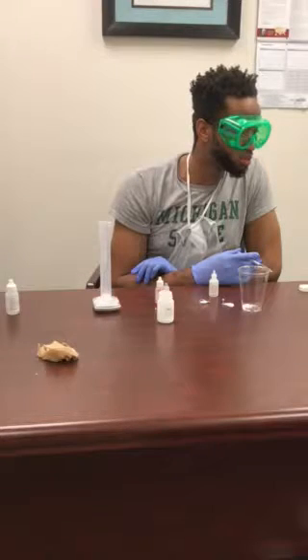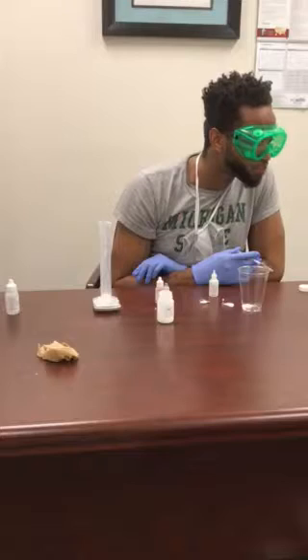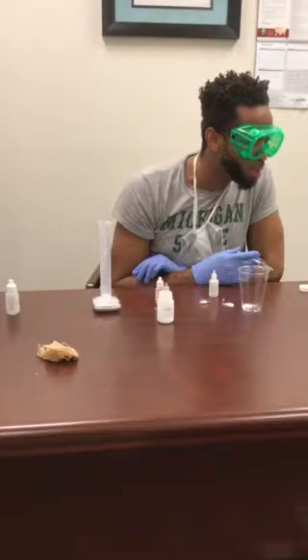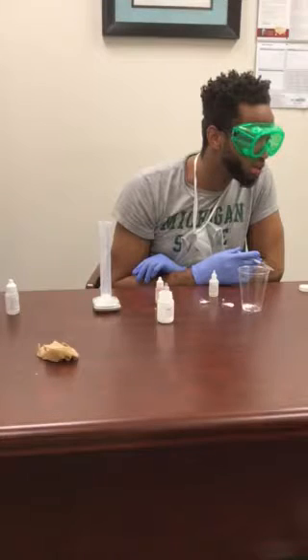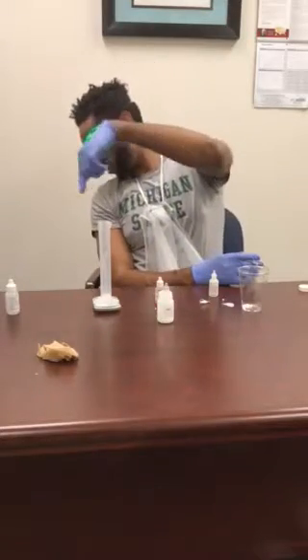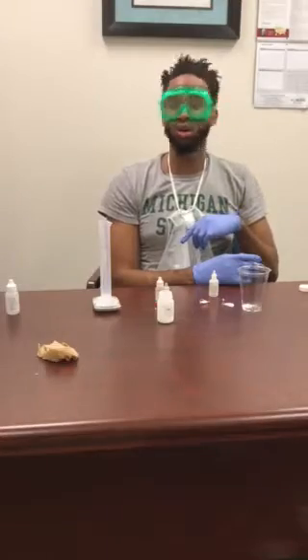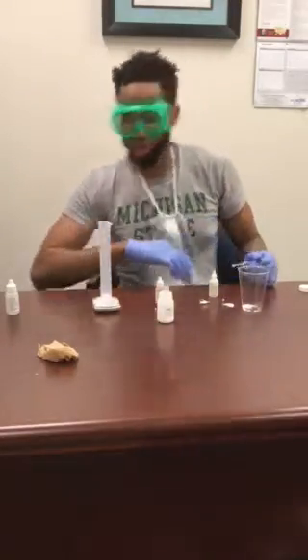And then I think we're supposed to see what the directions say now. Next. So record the initial volume. Place the flask containing 5 milliliters of calcium hydroxide, CaOH2, on the white sheet of paper. Okay, I'll grab a sheet of paper. There should be one right there, right underneath. Over here, right here.